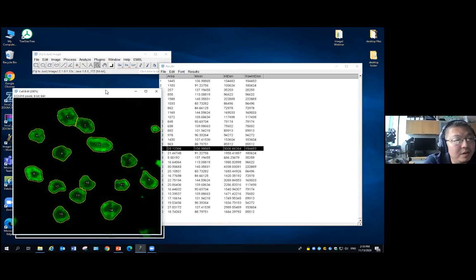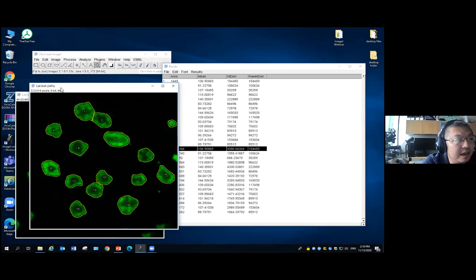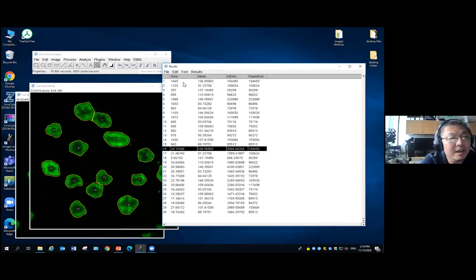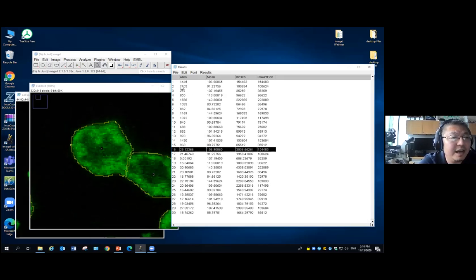It's because somehow with the cell B image, we lost the pixel information. Now I highlight the cell B, I go to the image property. As you can see, the pixel width is just 1 now. It's just a pixel. Somehow when you're doing something either in ImageJ or some other software, you lost the pixel information. So now what it gives you is actually the area in pixels. Like this cell number 1, what is the area? It has 1,445 pixels in it. Ready?